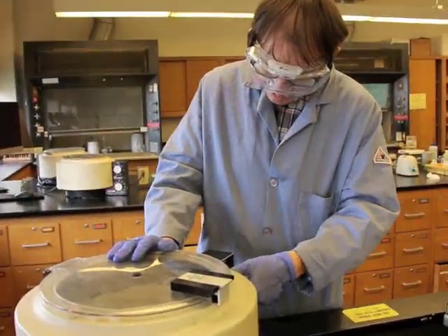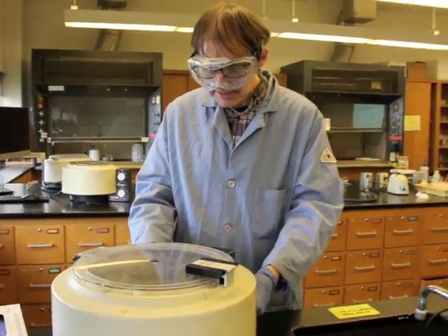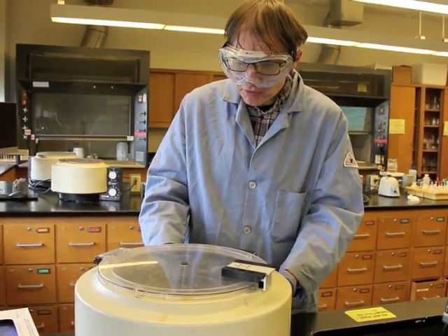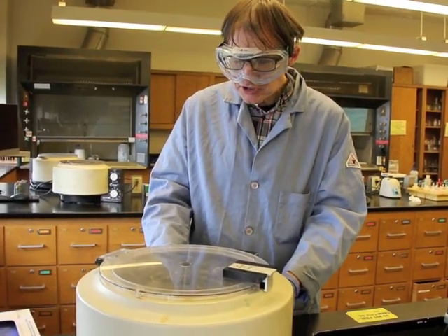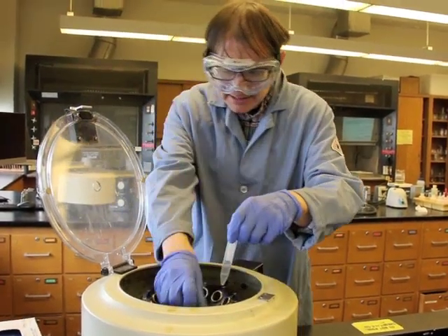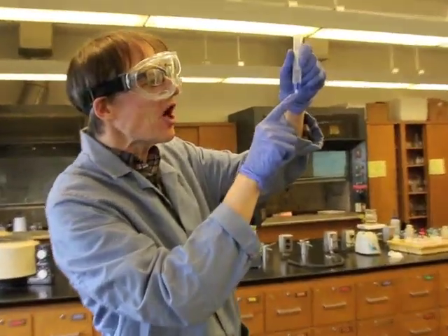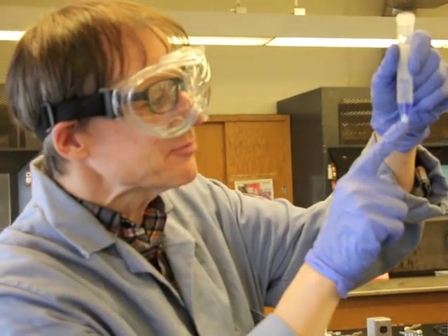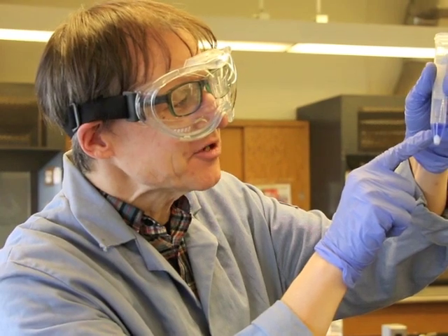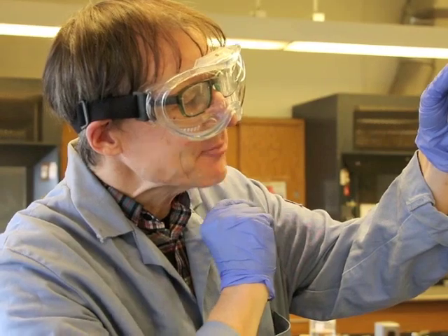Okay, so we've now done this separation, and this is the first step of analyzing for bismuth. If bismuth is there, we don't know whether it is. This is the unknown. So we're going to stop the centrifuge and take a look and see what we've got. Now, if you take a look at the test tube, notice there is a little bit of solid down there at the bottom. So there's definitely a precipitate. So we're going to analyze that precipitate. Again, this is the supernatant up here. We're going to pour that off, and we're going to use that in our analysis for copper and silver.